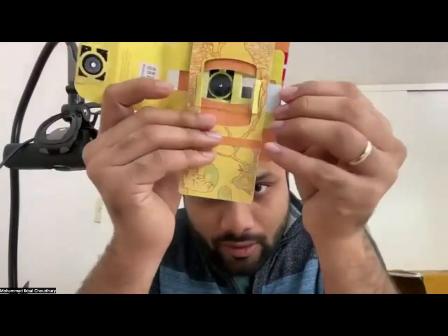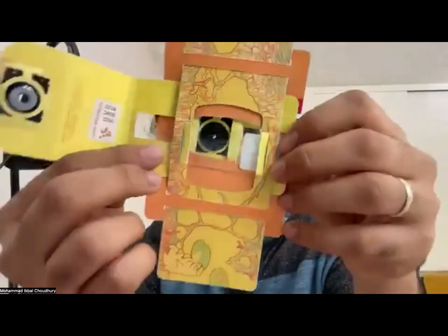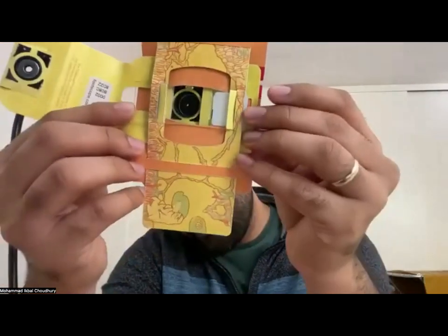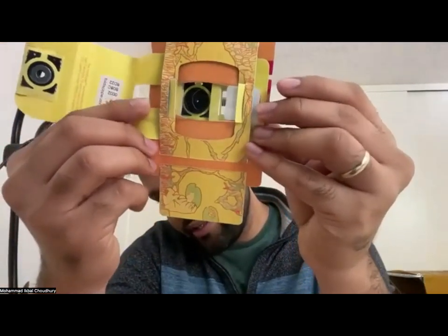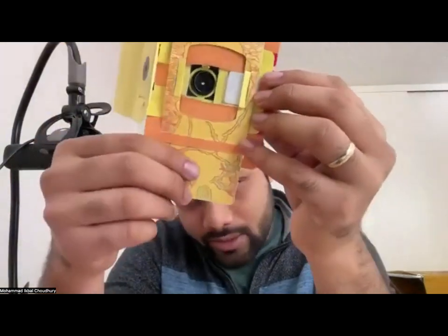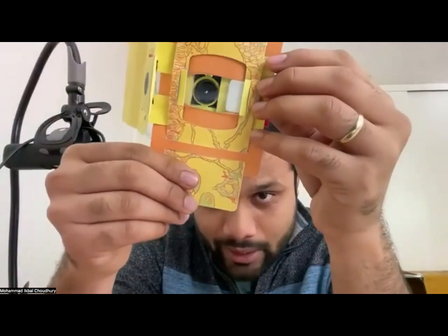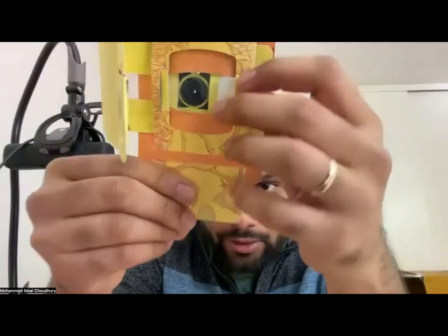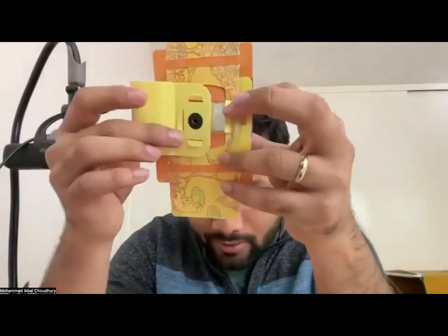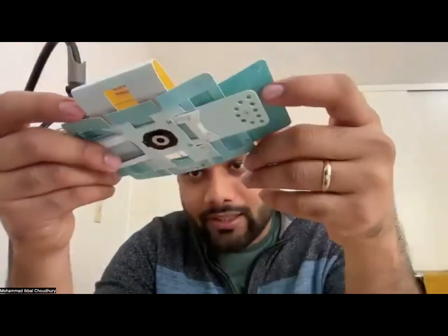Okay. So now you have your sample in there. You can move the sample like that, or you can keep the sample where it is and try to see if you can bring the lens closer to the sample, like here. And then it's easy.